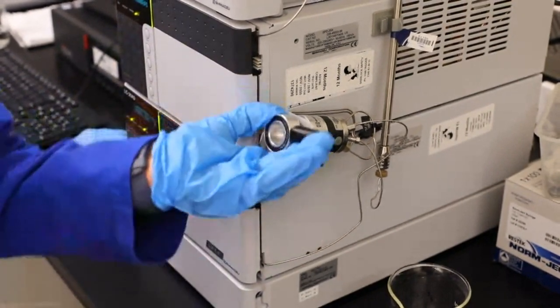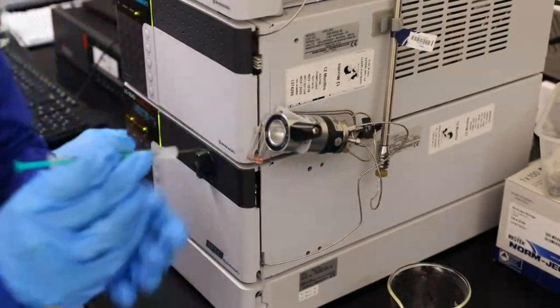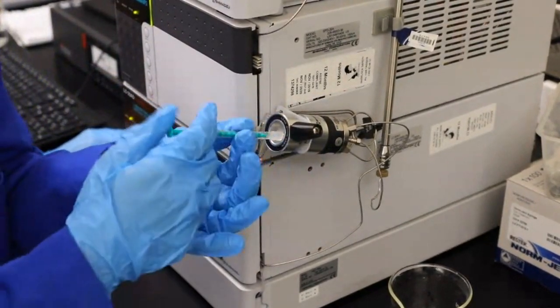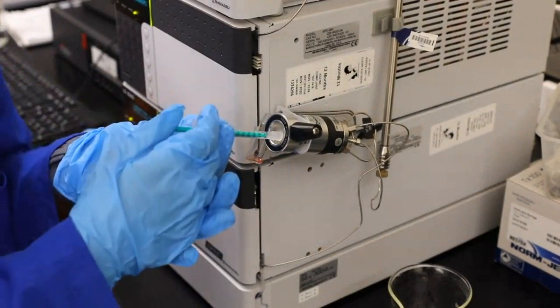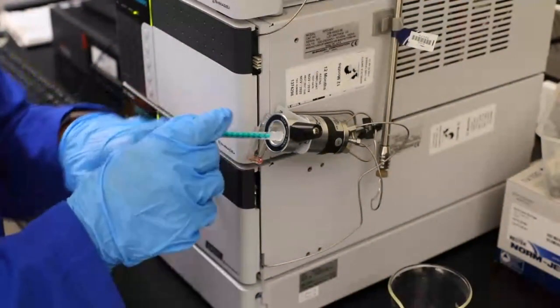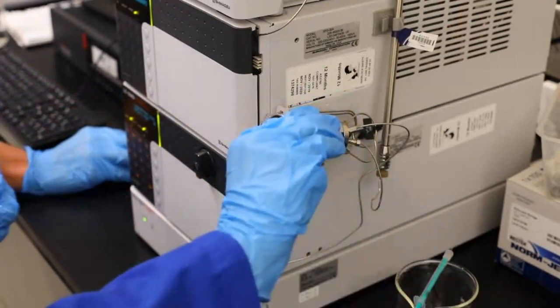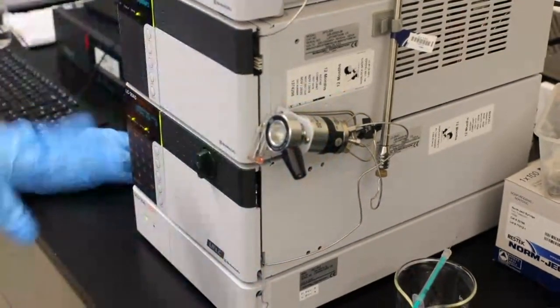All right. So what happens is you have your syringe here and it's got our little sample in here. You then simply put your syringe in there and keep note on here is where another spot where our waste goes. So you simply put it in, and when enough has gone in, you can see little drops coming out. So just put that there, and then you simply eject, and then that sample then will run into our machine.